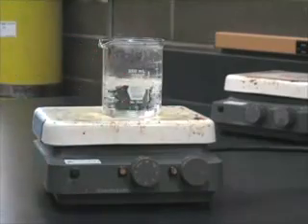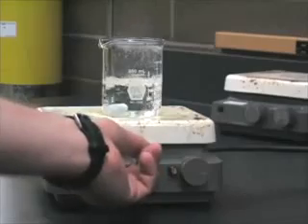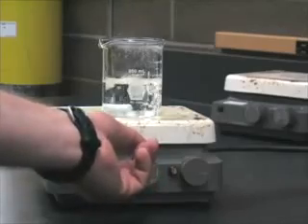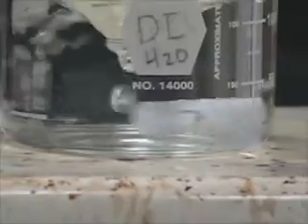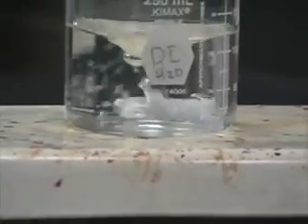When using a magnetic stir bar, insert it cautiously into the liquid and then simply activate the magnetic stirrer. It's kind of fun to watch them. A magnetic stir bar is nothing more than a magnet in and of itself, and a magnet under the magnetic stir bar mantle is what allows the propulsion to occur.